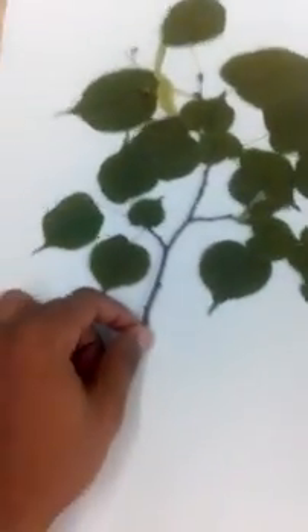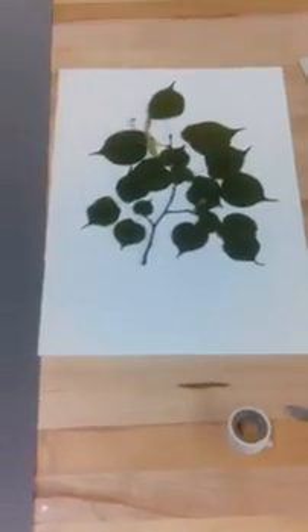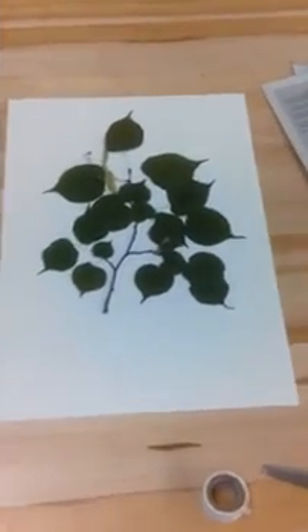Other classmates in here mounting plants. So you get your plant and you want to center it in the middle of the page so that it kind of takes up the entire space of the page. You ideally want a specimen that's going to look nice and also show a lot of the really key factors of this plant — so the jagged teeth, some of the fruits, that kind of stuff.